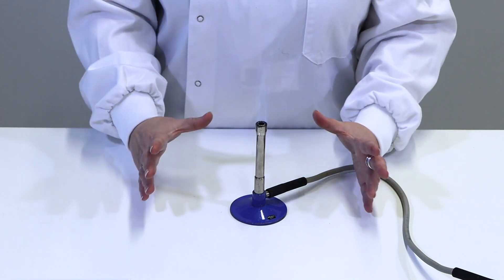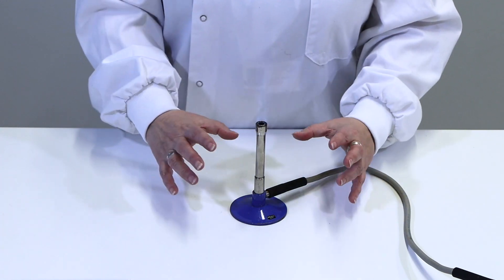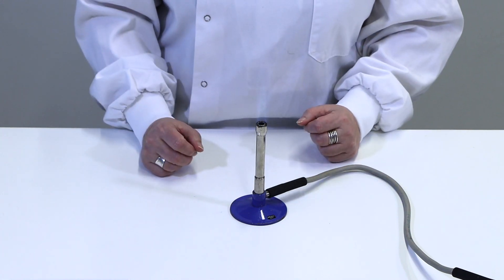So in this area that we've created we will have a sterile zone roughly this size, in which it's okay to open lids on bottles and dishes without risking contamination.